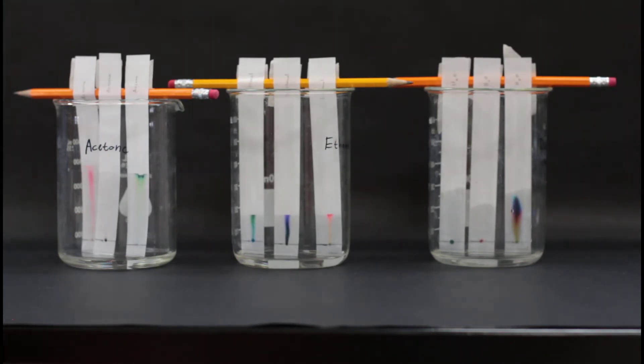Let the solvents rise for 15 minutes. Notice how the colors on some of the inks begin to separate, and how the ink doesn't travel in all of the solvents. Some of the inks just don't dissolve in some of the solvents.